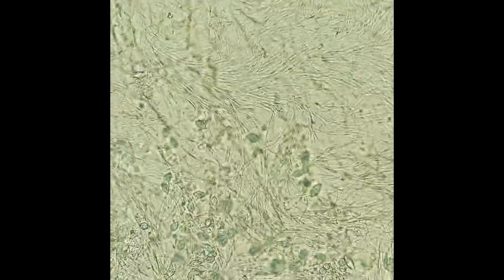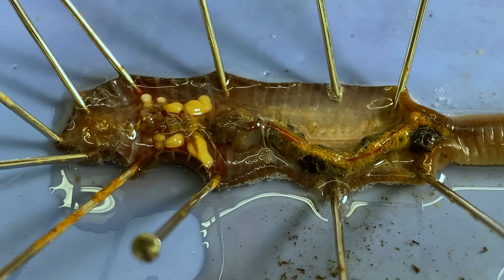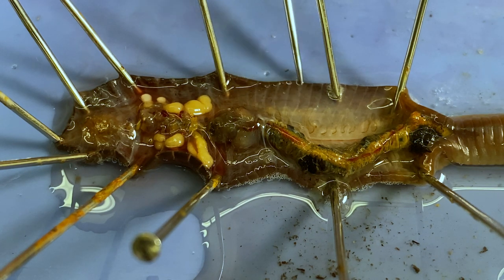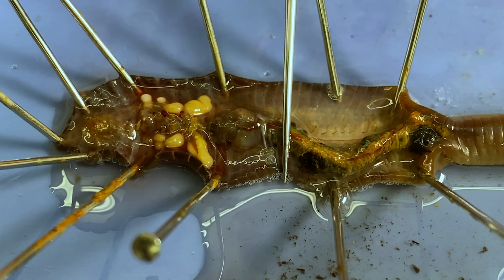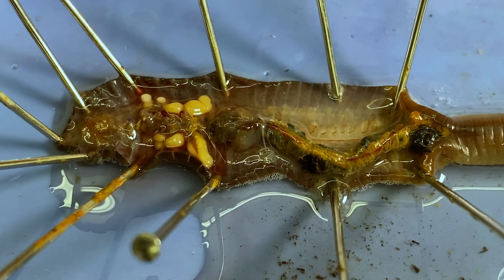Here's what it looks like when you pluck out a spermatheca and put it under a compound microscope at 400x magnification — these are all worm sperm, and they're swimming like crazy, creating currents. You can very clearly see their tails moving. Back in the dissection, you can also clearly see the lines of the septa — there would be a sheet of membrane connecting them internally and separating the segments, which I had to break through to open up the body wall.